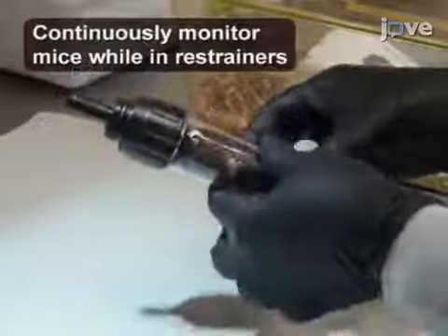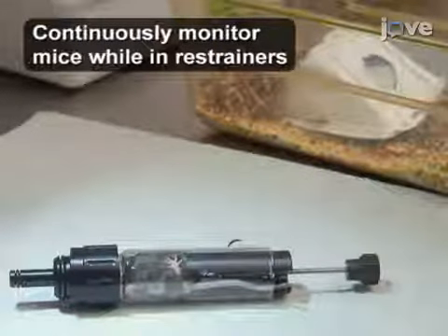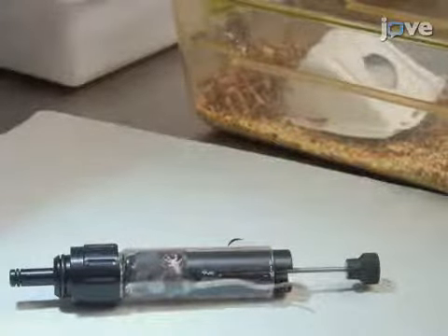Fix the variable position plungers into the back ends of the restrainers so that the animals can rotate but not turn head to tail. Loading the mice into the restraining tubes takes patience and coordination. Please handle the animals gently.